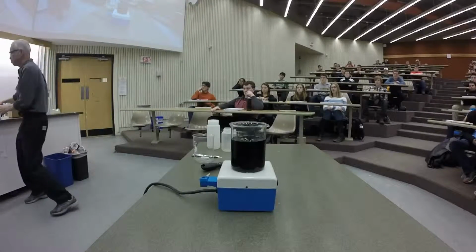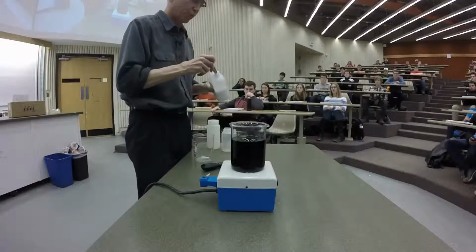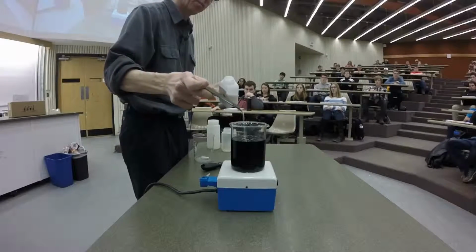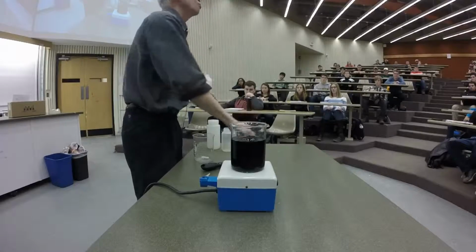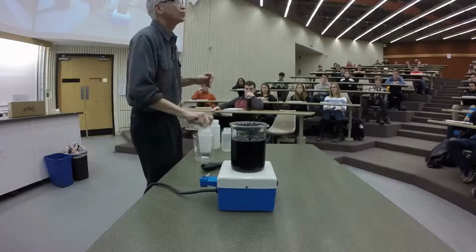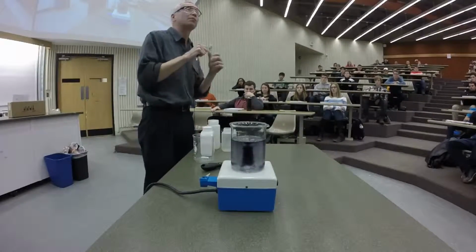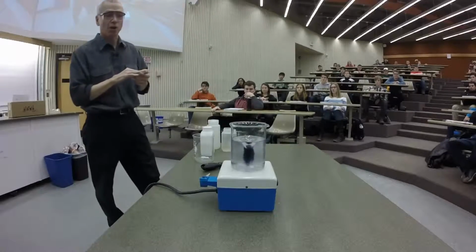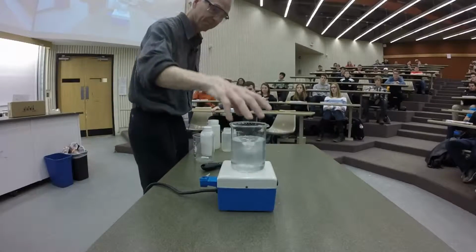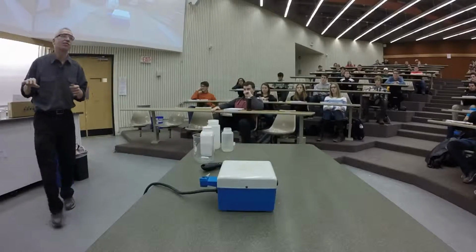Now, I have to dispose of this material, so we really shouldn't throw the iodine down the drain. We need to neutralize it. If I add a little sodium thiosulfate, it reacts with iodine, I2, to convert it back to iodide. So in other words, we're eating up the material that is forming the blue complex. So adding my thiosulfate, I get rid of the blue color. There's our clock reaction. And it took about 10 seconds.